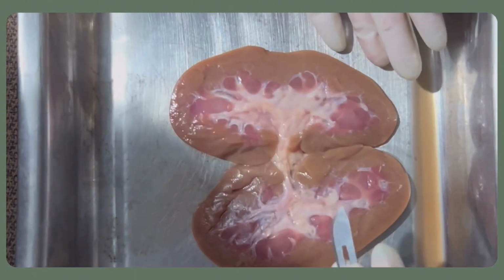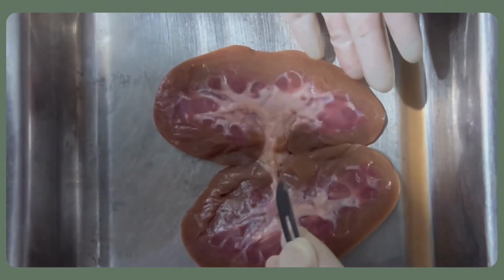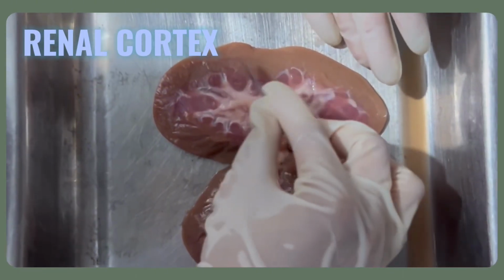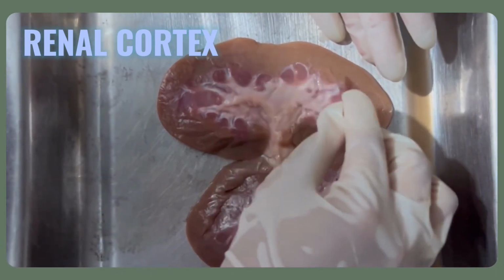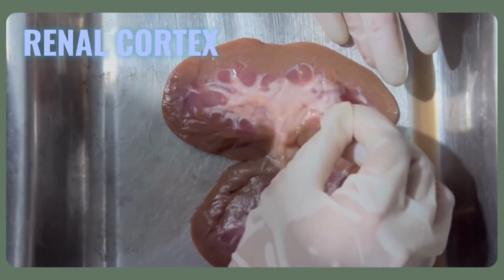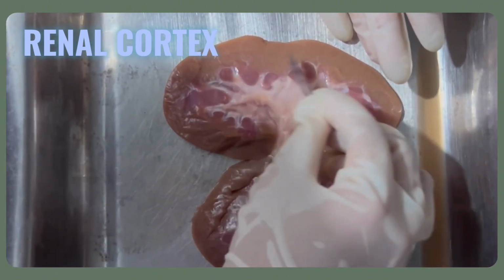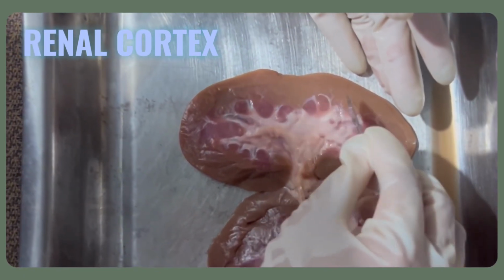After dissecting our kidney, we are now going to identify the internal parts, or the three regions of the kidney. First is the renal cortex. The renal cortex is the outer layer of the kidney and is located between the renal capsule and the renal medulla. Its main function is to filter the blood to form urine, and it also aids in the reabsorption of essential substances from the urine back into the bloodstream.